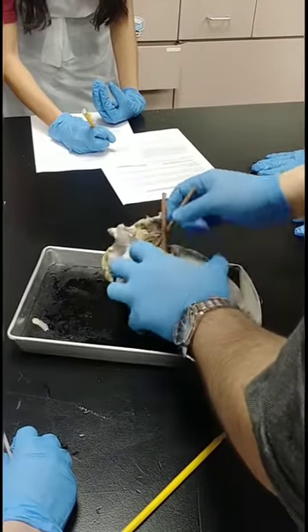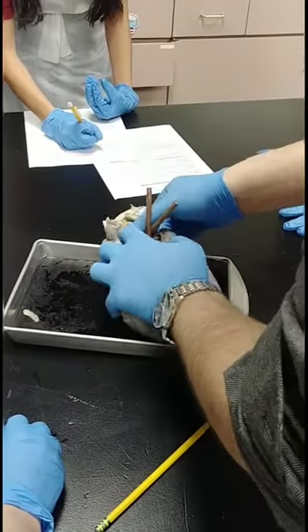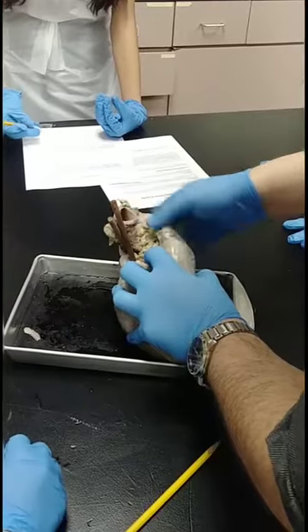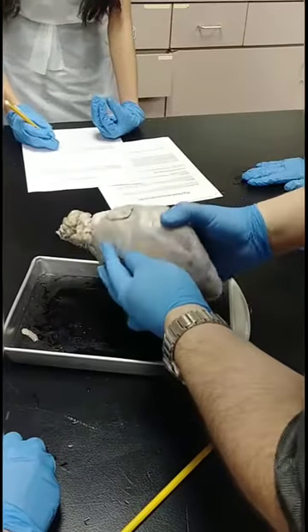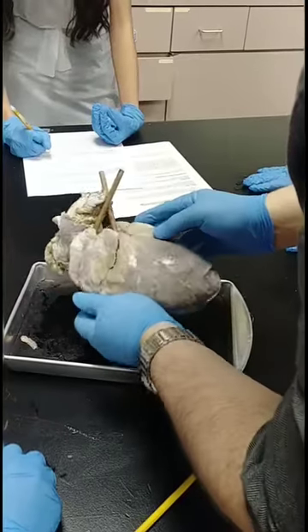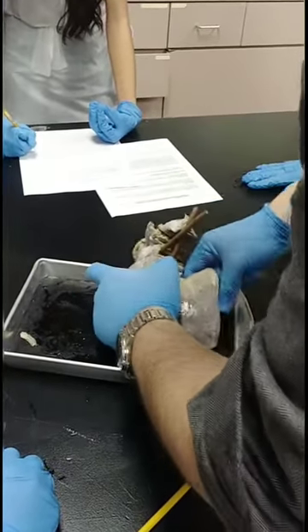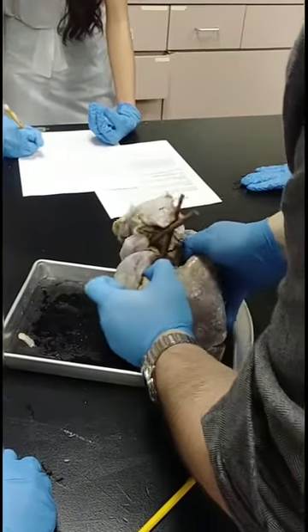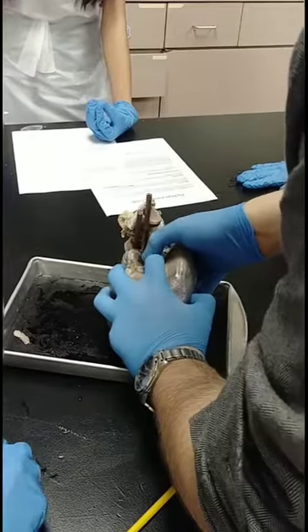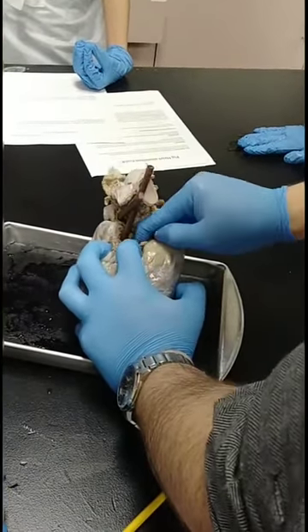You can use your scalpel to get some of that fat out of the way. Be careful when you use these — they're sharp. Remember, if you need to go, step outside. Here's the front of the heart. The back of the heart is there. This is one of the vena cava. It's a thin vein going into the heart.